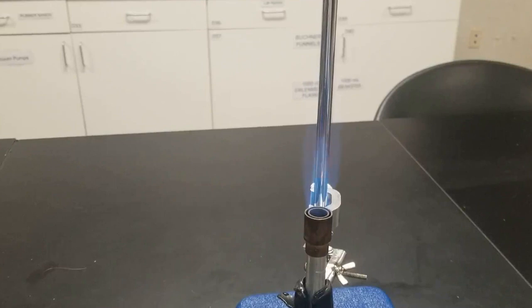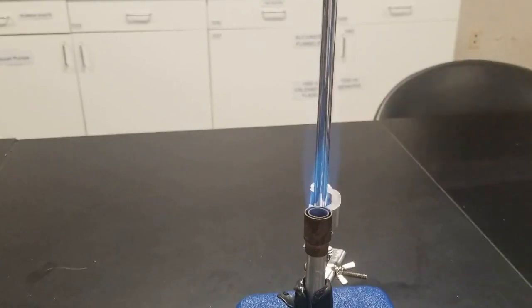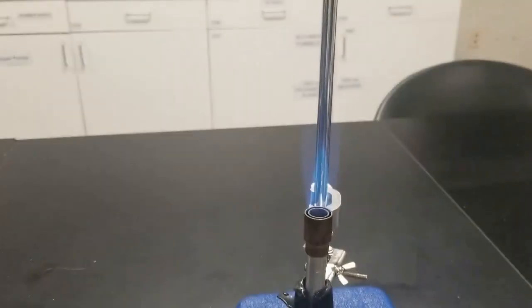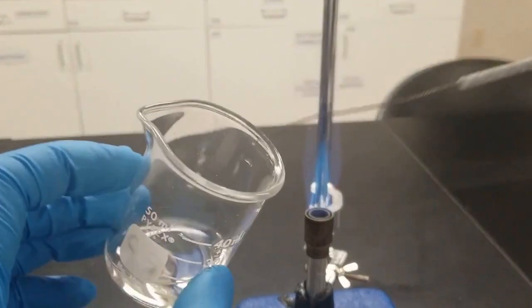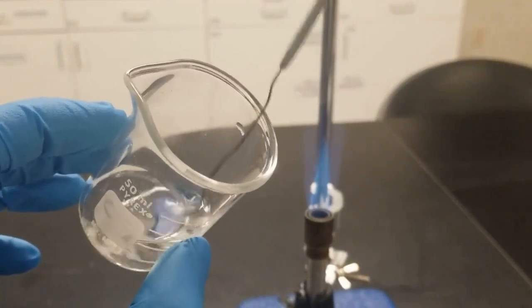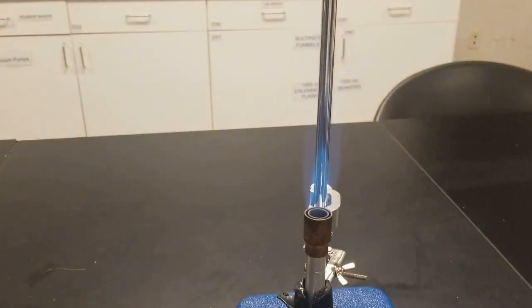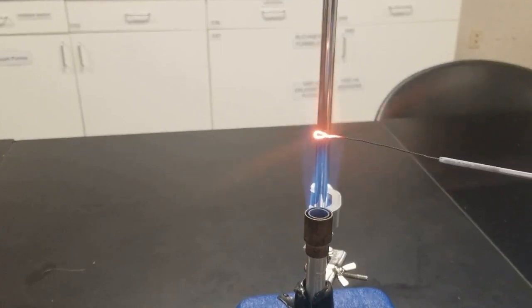All right, next up is our flame test. So you can see I've got this nice inner cone, and the hottest part of the flame is going to be the tip of this inner cone. So I've got my hydrochloric acid. I'm going to take my inoculating loop, dip it in some HCl. This will help wash it off of other ions, form the salts, and burn them off essentially. And then I'm going to put it on the tip of the inner cone until the flame is colorless, and I'm going to repeat this process.